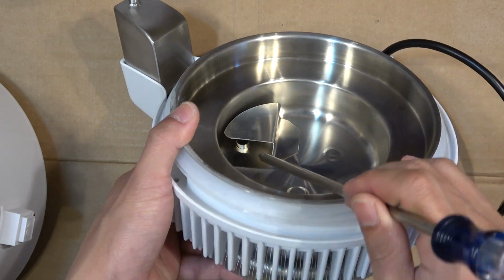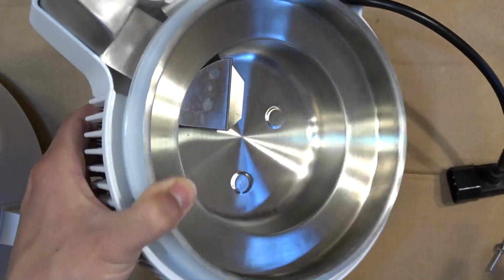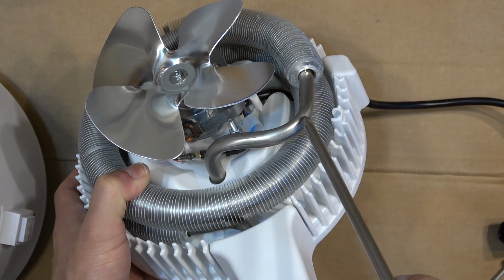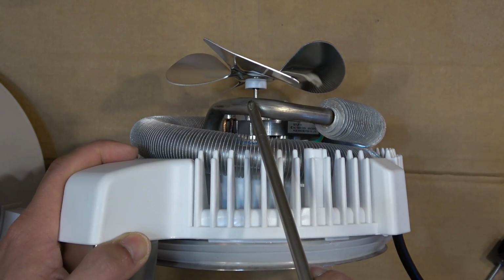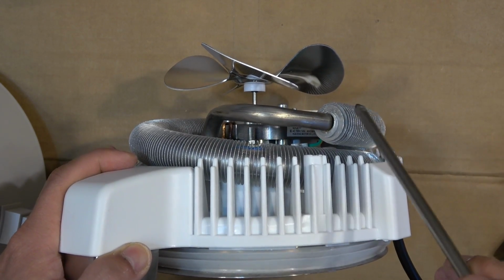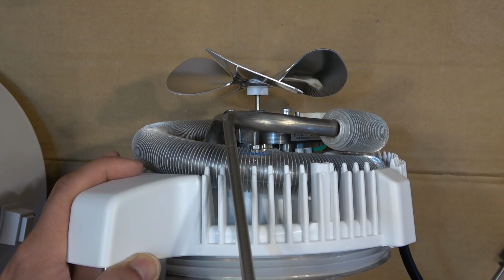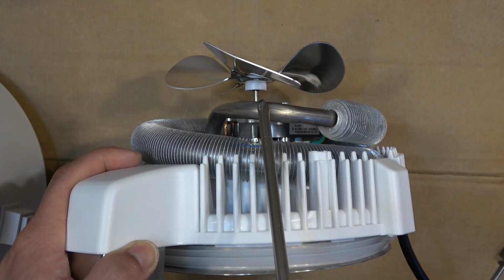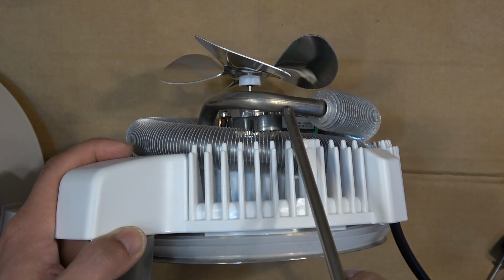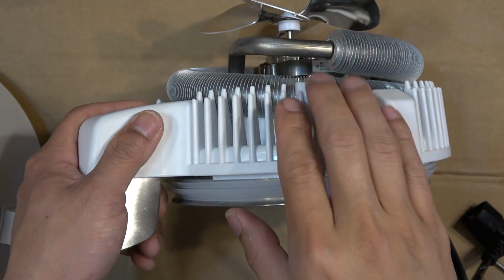So the vapor will rise and go into the coil right there, and then it will go up the coil this way. Now that is the very top of the coil. This part here is still really hot, and there's no heat sink. So they do this on purpose. They really want this part to be hot, because you want this to be still vapor when it gets to the very top of the coil. Then when it starts to go down, gravity will pull it down this way. So this just works by gravity. It will pull down here.